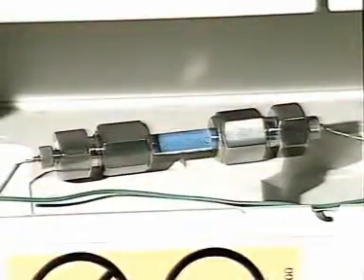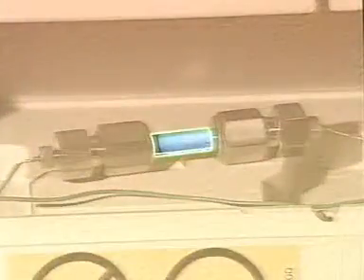Inside the instrument, the separation takes place in a column packed with tiny particles of porous silica. A mixture of solvents, the mobile phase, is forced by a high-pressure pump through the tube of silica, the stationary phase. Different compounds move at different speeds through the tube, depending on their relative affinities for the two phases. The compounds become separated.